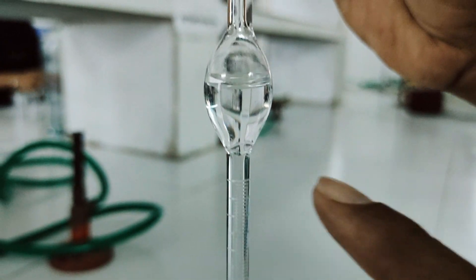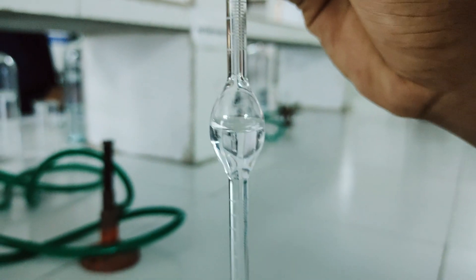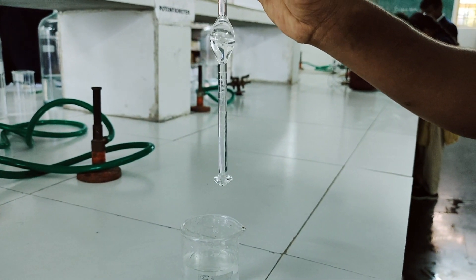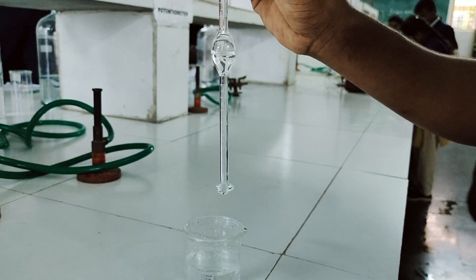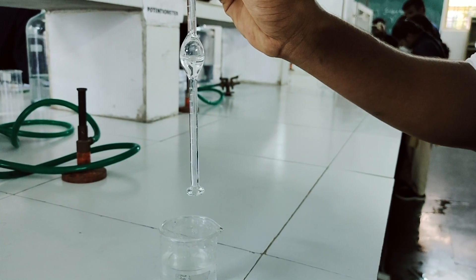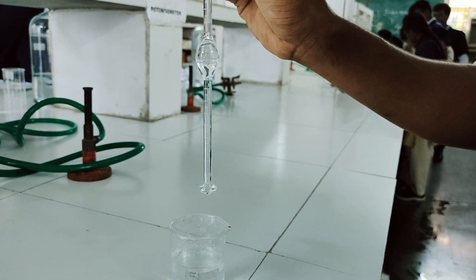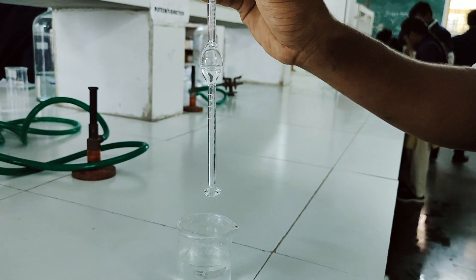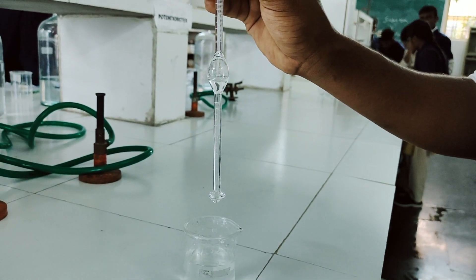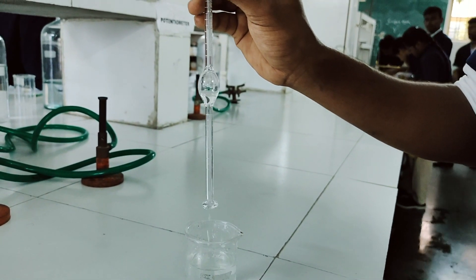This is mark B. Count the number of drops and observe how they are falling. With the help of the mathematical expression γ1 by γ2 equals D1 by D2 into N2 by N1, incorporating these values will give you the surface tension of the unknown liquid.